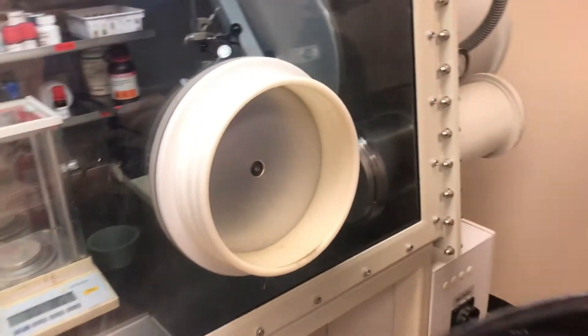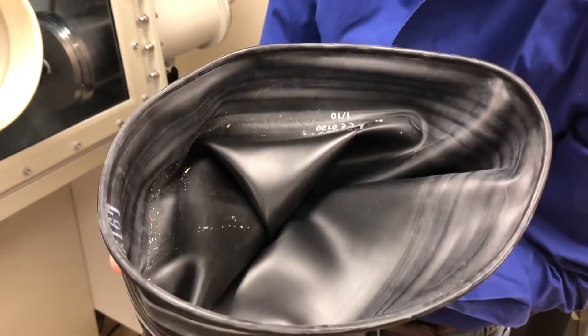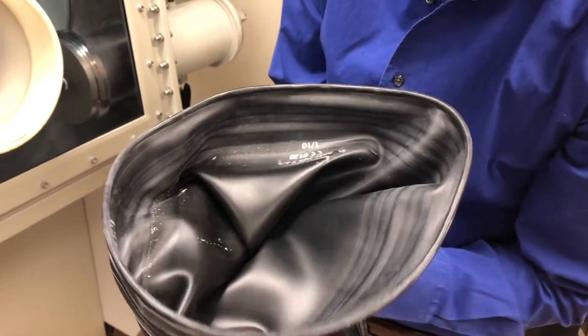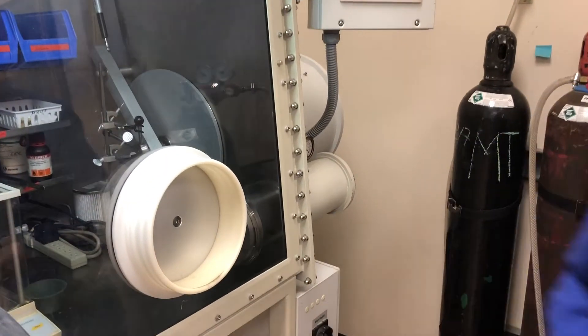This is a little bit scary. There's all this dirt in here that accumulated. We can even see maybe some glass shards. These are of course the parts that can really damage the glove. And we want to clean this part out while we are here.